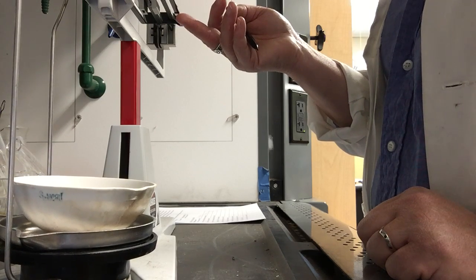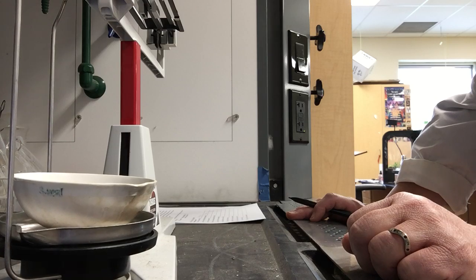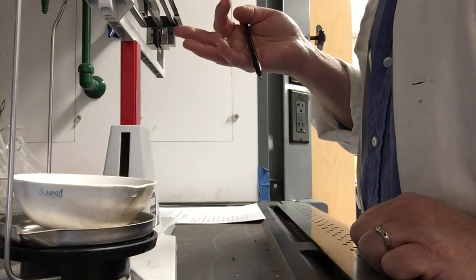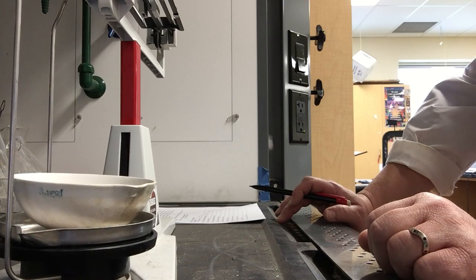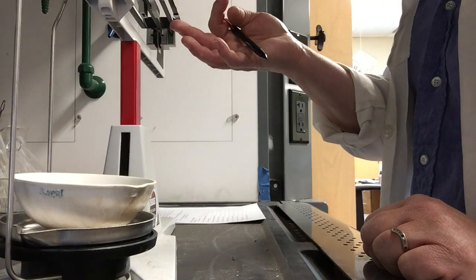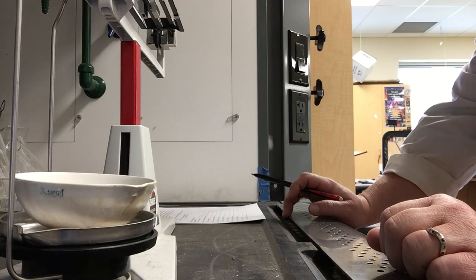Move it back to 0.75. We're really close. It's moving up and down. Maybe just a little bit heavy here. We'll move it to 0.7. Okay, and it looks like I need another maybe 1/10 of a gram. Okay, and that is balanced.